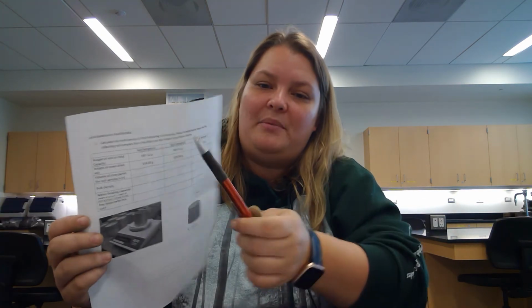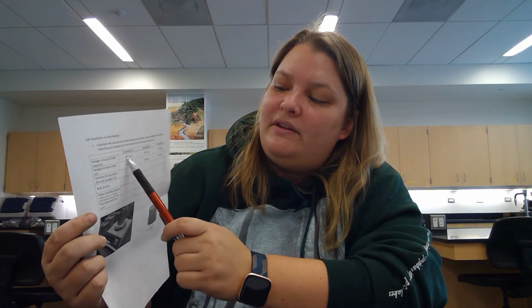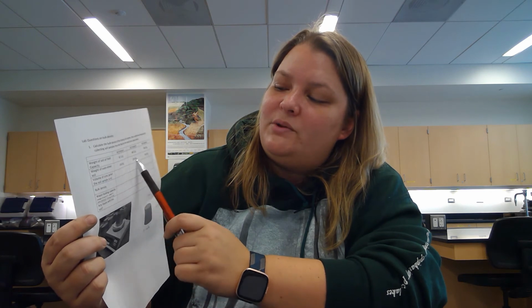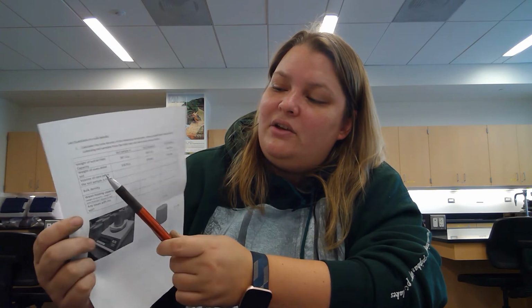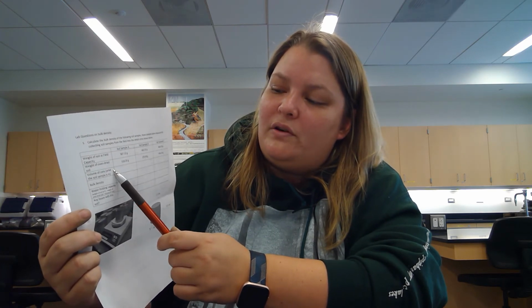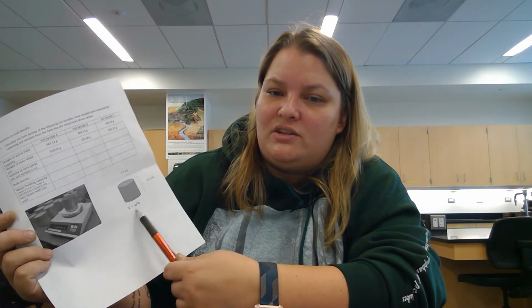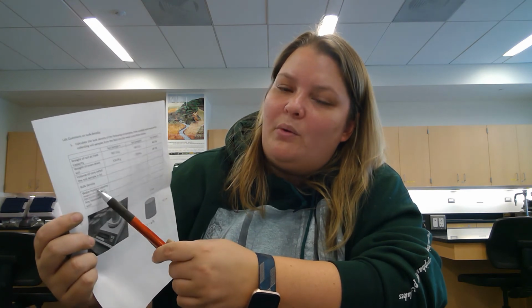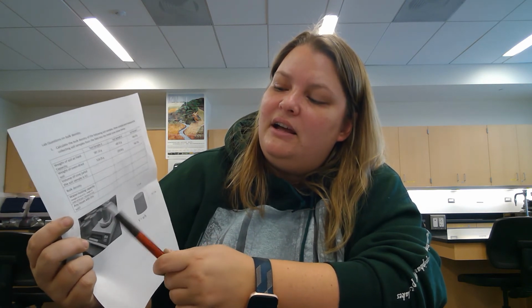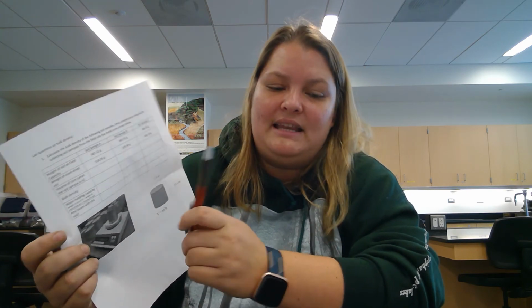On the back side of that page, this is giving you some information like weight of the soil at field capacity, and then the weight of the oven-dried soil. And then again, using the equations you know to figure out bulk density, you are going to have to determine the volume of the core, which we're saying are these metal cores here, and that equation to figure out the volume is right there. And then you can figure out bulk density, you can figure out water holding capacity, the equation's there, and you can think about the bulk density number and how that might relate to any issues plants would have growing in the soil.